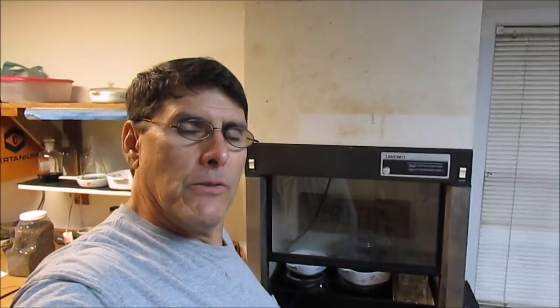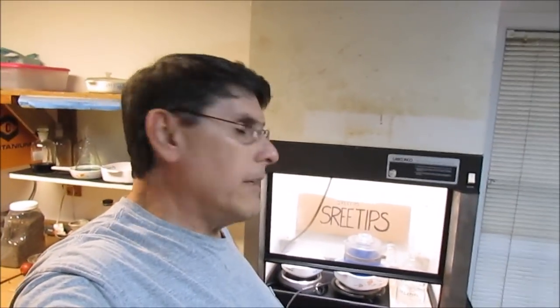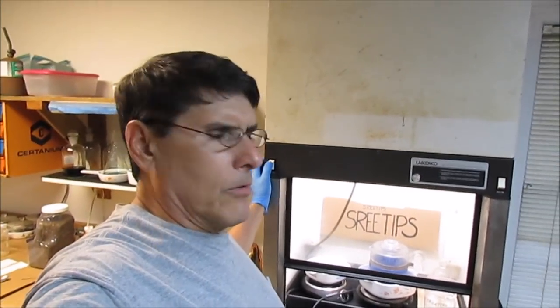So now I'm back in business with my Fume hood. I've got a light installed, it's nice and bright. I like to work up real nice. And I got a brand new motor. I bought the motor at Grainger, I think it was $109, and it works just perfect. So I'm back in business with a Fume hood.